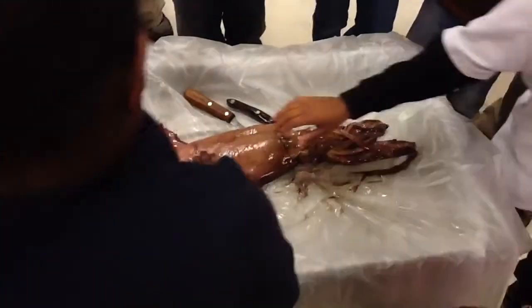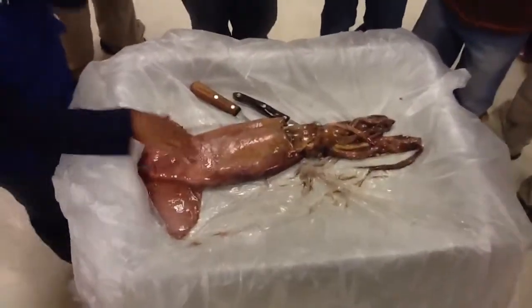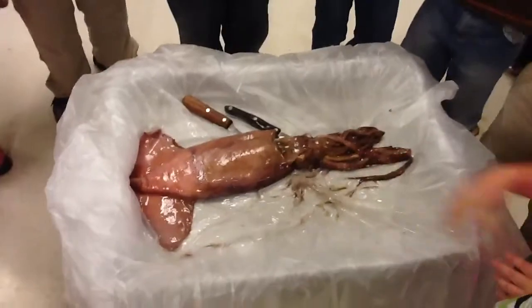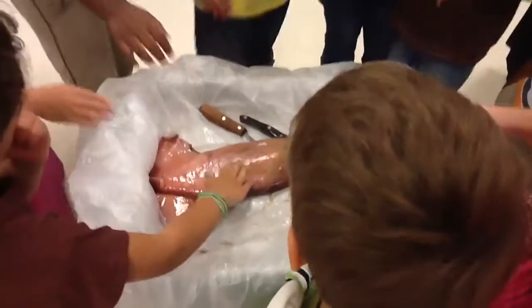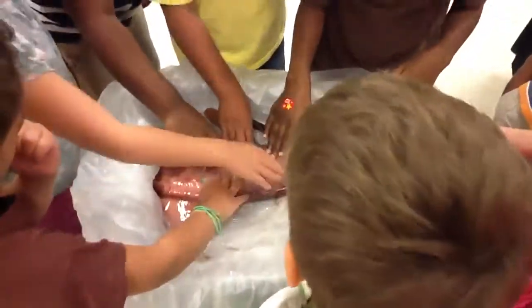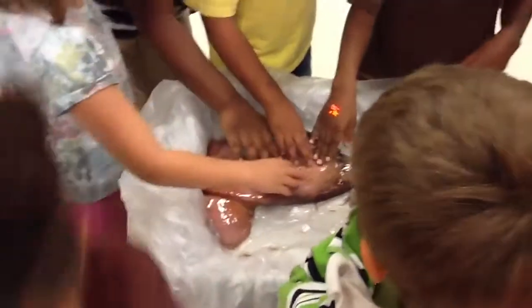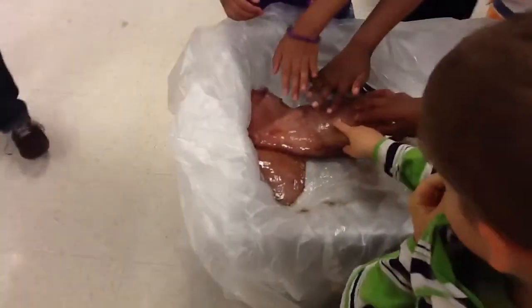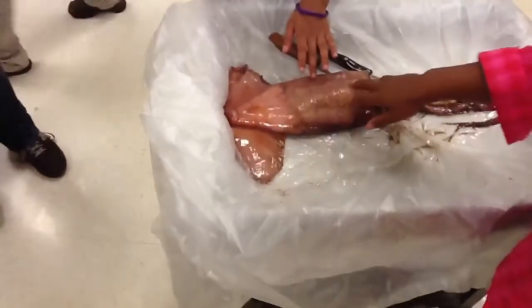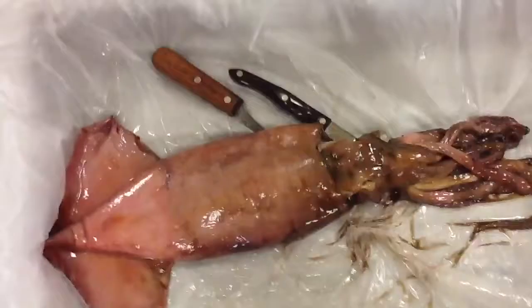If you're at the blue table, you want to feel it? Jerry, what does it feel like? Describe it. Does it feel like skin? Green table, go. What do you think it feels like? It feels weird — it feels like a soft face. Go wash your hands with soap and water. Don't touch anything else. It's so soft. All right, we've got to cut it open.